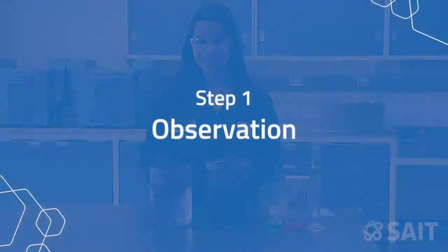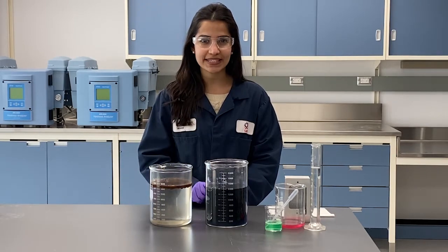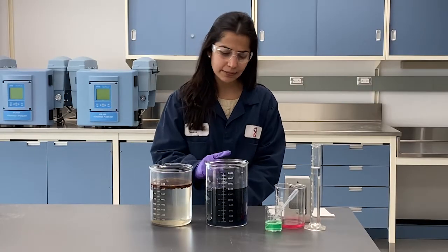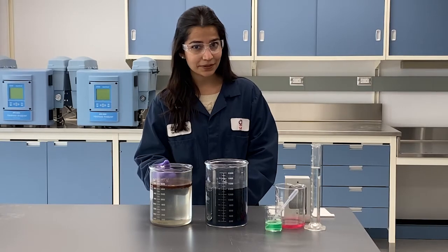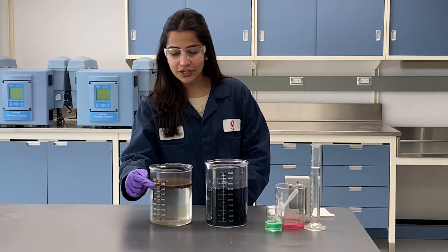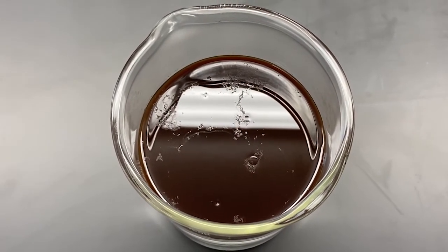these samples are. The first thing you should do is always look for more clues. So take out your pens and pencils and write down in your notebook what you see the differences are between these two samples. In the very first sample, if you look closely, you see a blackish blue color all across the water profile. The second sample, on the other hand, the water looks very clear, but there is a sheen on top which looks brown, and if you look from the top, there are different droplets that are formed on the surface.